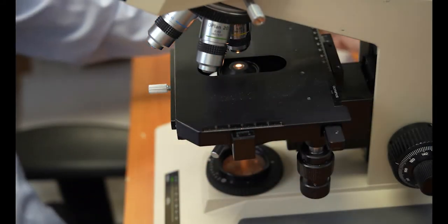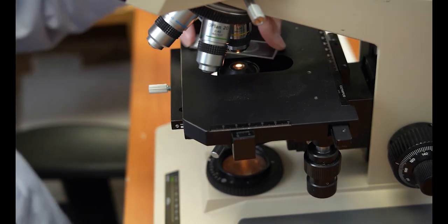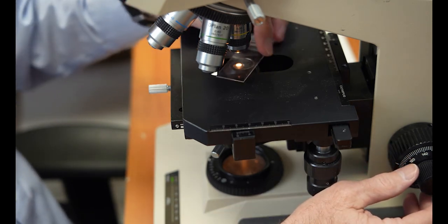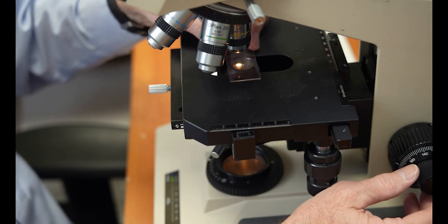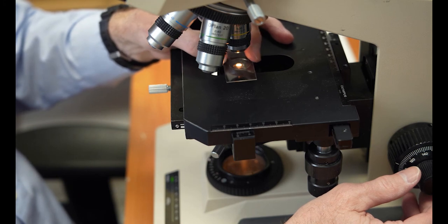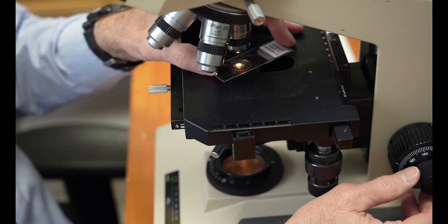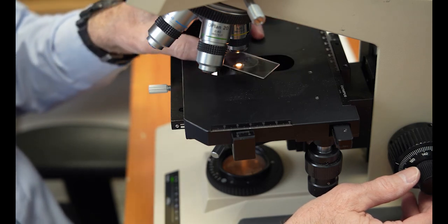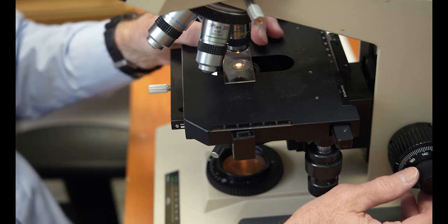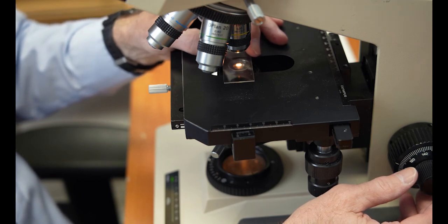We'll set the stage off to the side and we'll next pick up a microscope slide with a sample on it, to use the stage and the slide and be able to very quickly maneuver our slide around on the stage. And again, you can move it in very small increments or very large ones. You can make it so that it's in various different orientations if you need to, unlike your mechanical stage. Clearly an advantage to having it hand manipulated rather than using a mechanical stage.